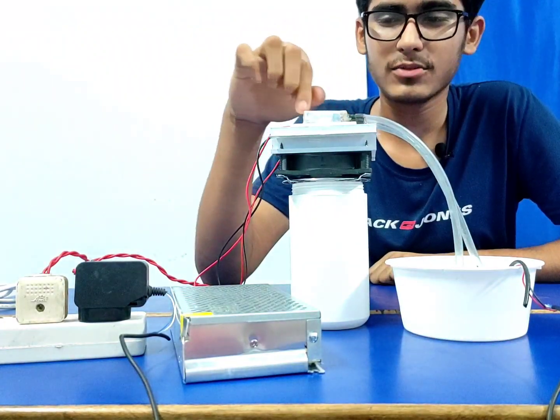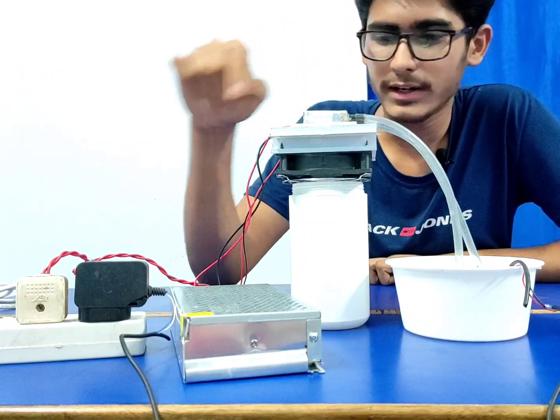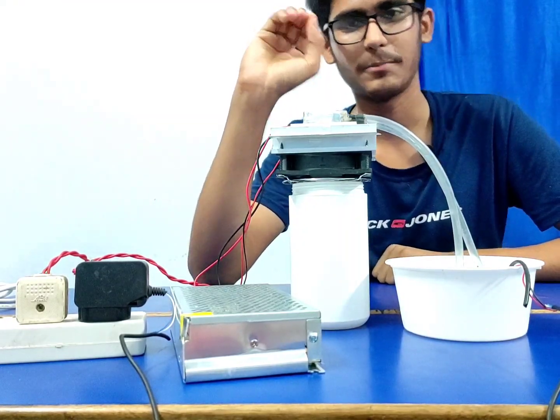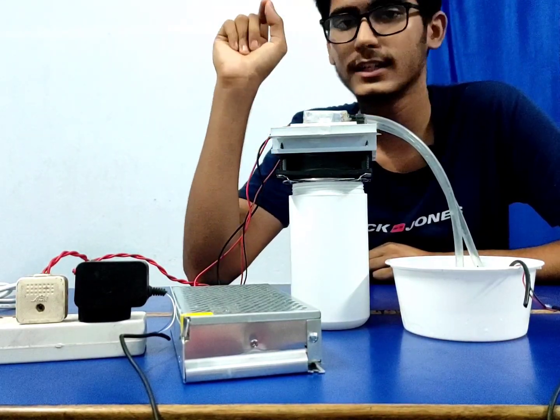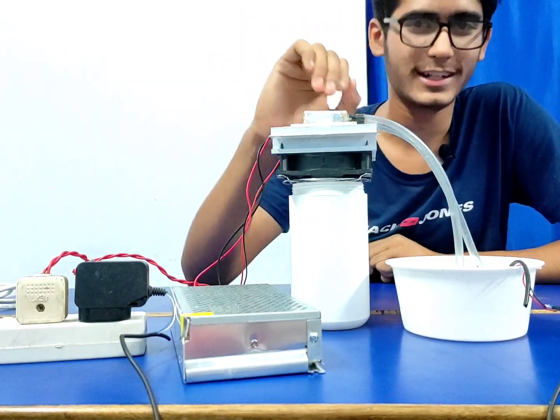Then we will get at least a 20 degree temperature, and it can go much lower, because 20 degrees is not the actual optimum gap. This Peltier module at 12 volts takes 3 to 4 amps, or a maximum of 6 amps at very high power when it's completely functioning. It will have a difference of about 45 to 60 degrees. So if we cool it down, like, it's getting very hot with this fan, I have to change that module. That's why I am calling it a prototype.